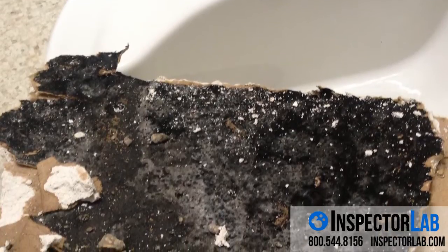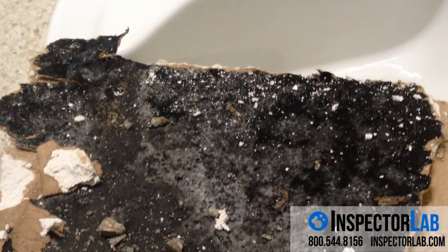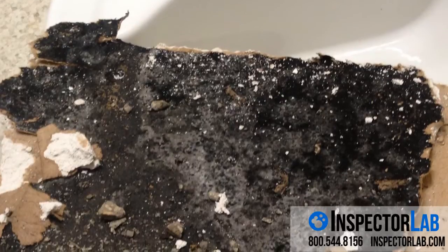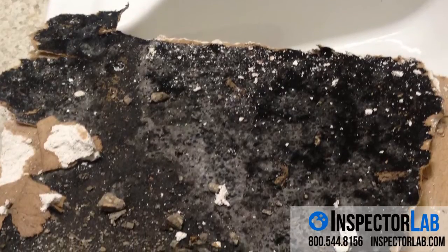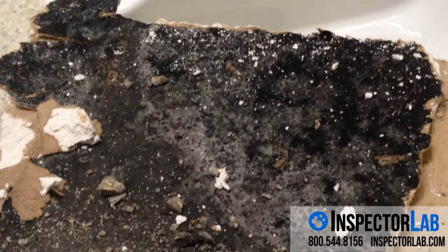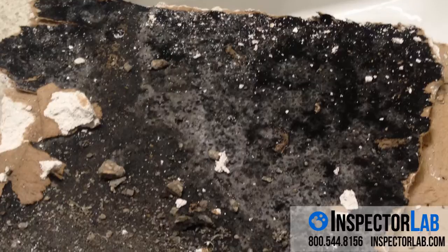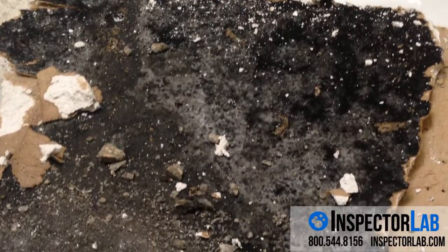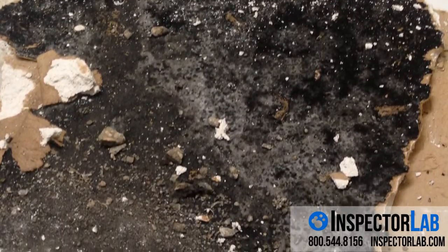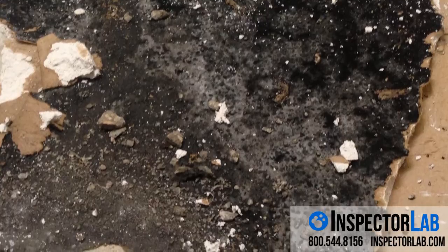It is not necessary to use gloves when taking a bulk sample. Mold counts from bulk samples are normally not performed because the counts are essentially meaningless, due to the variability of surfaces and materials and the various ways the mold growth is collected from the bulk sample.